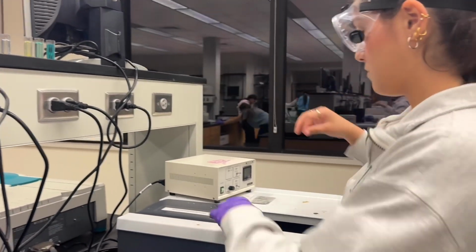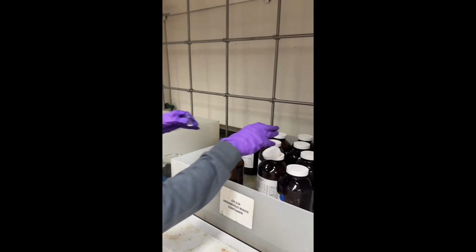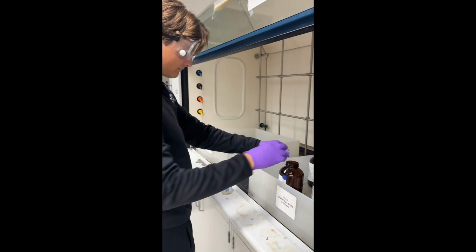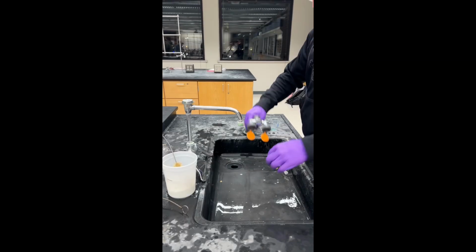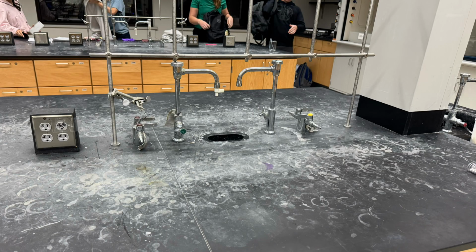Now, when you're done with the spectrophotometer, make sure that you clean up your area. Same thing for your lab area that you used for the first 2 exercises. The solvents that you use need to be poured into the waste containers in the fume hood that are in the back of the room, or depends on your classroom. And the solid waste, like the TLC plates, can go in the regular trash can, and the capillary tubes can go into the glass disposal bins. So here's our lab area all cleaned up.